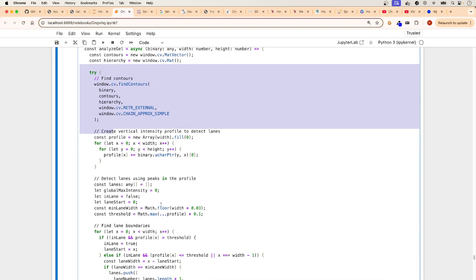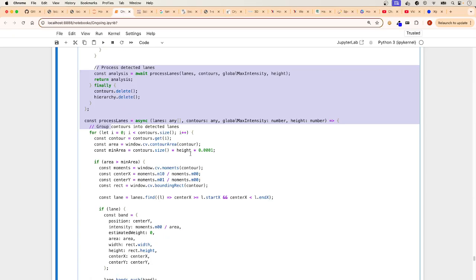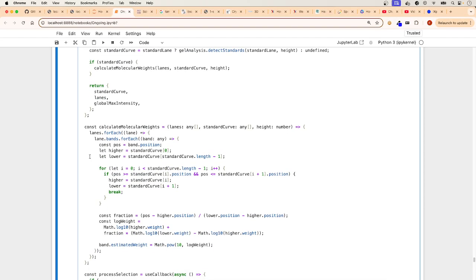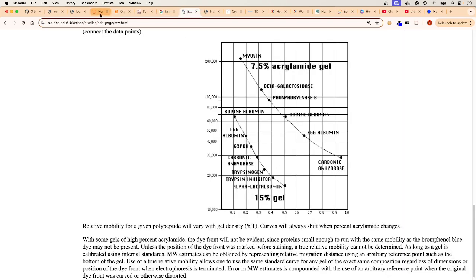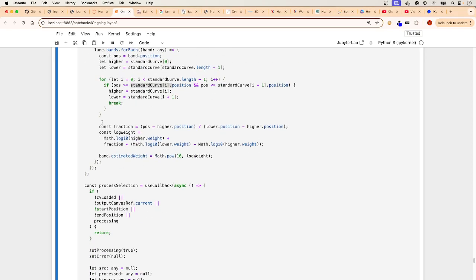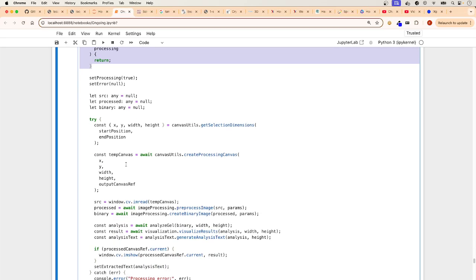And then applying OpenCV on it, and nothing that you haven't seen. It's just detecting lanes, but before we were detecting other stuff, OCR, but it's the same logic and same algorithms. Here is where the molecular weight is calculated. All it's doing is the standard curve that I talked about here. This is the math under the hood. This is where it's going on, and it's calculating. And here is the validation to make sure. We've done it a million times, so you know.